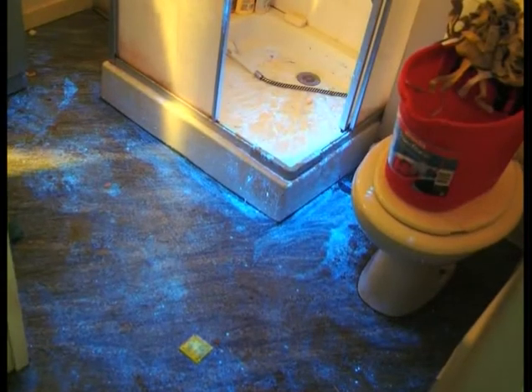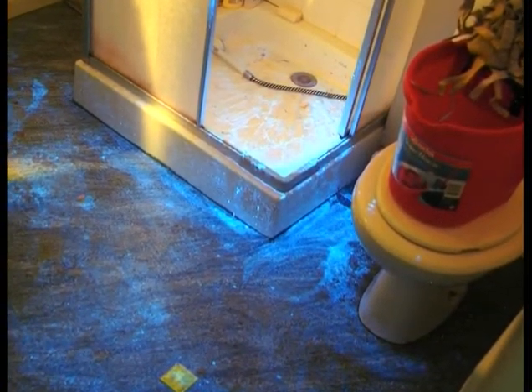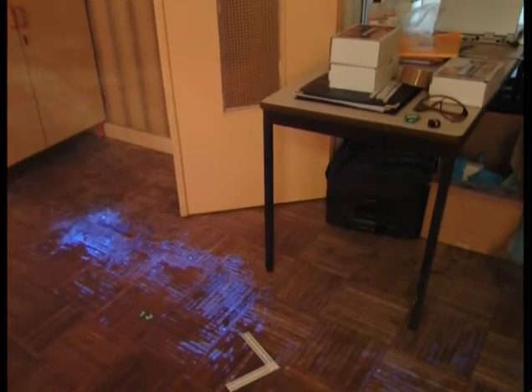It's good to have a compromise between semi-darkness and a little light, because it is always essential to be able to create a photograph of both the luminescence itself and the zone where it was discovered. If we were in pitch darkness, we would not know whether the trace was on the floor or a wall. The settings between semi-darkness and light should vary during any treatment of the scene.